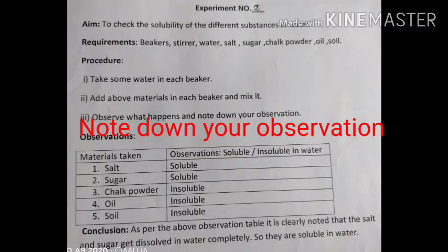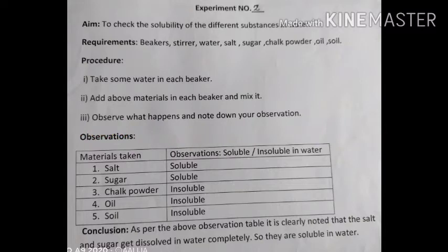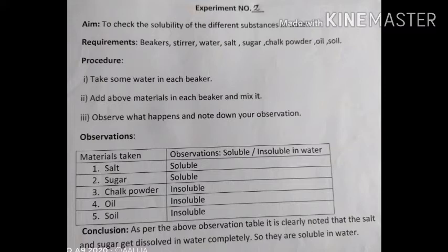From this observation you can record your observation and note it down in your experiment book. From this experiment we have learned that some substances are dissolved in water and some are not dissolved in water.